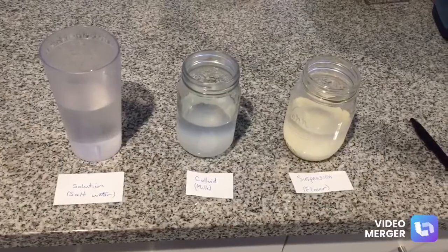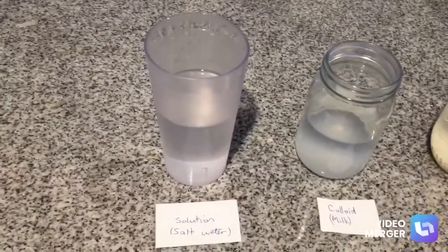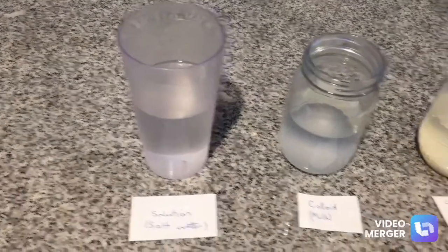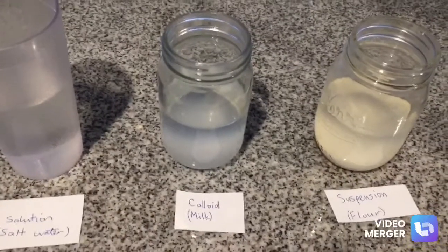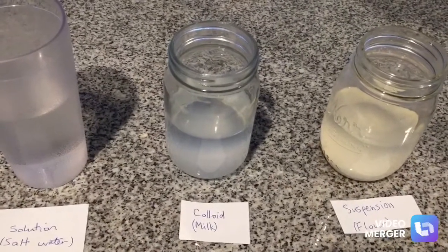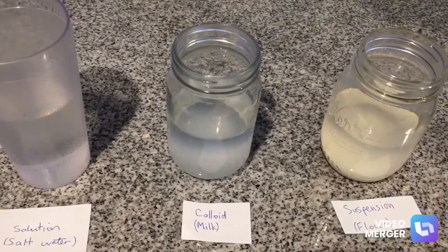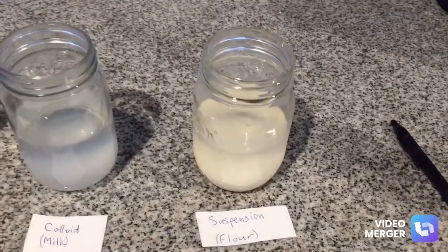Here are my three mixtures. Salt water, which is my solution, which is an example of a solid in a liquid. Here is my colloid mixture, milk, which is an example of a liquid mixing with another liquid, to give us a type of colloid known as an emulsion. And here's my suspension mixture, flour.